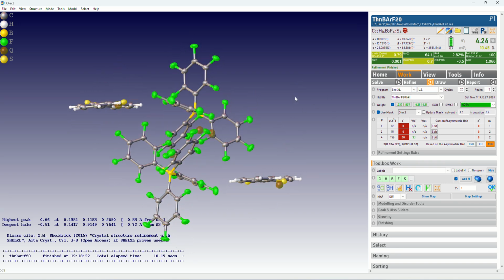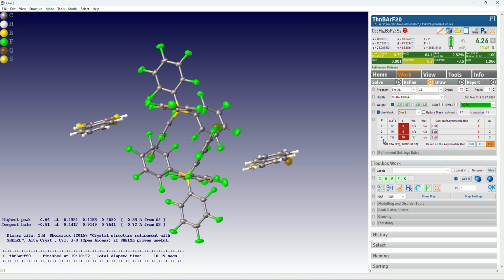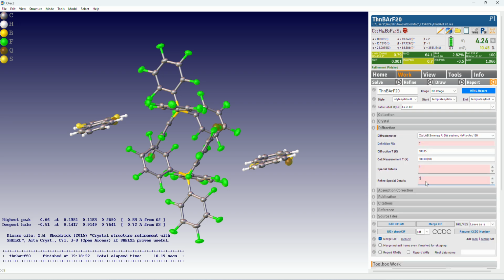Okay, so the last thing that's left is to describe in the CIF file that we used solvent masking. It is by default put in the CIF file by BYPASS, by OLEX, but I think it's always a good idea to also go to report. You can go to diffraction, and either in special details or refine special details, you can write something like, I don't know, solvent masking was necessary because of a large amount of diffuse electron density corresponding to disordered solvent that couldn't be modeled. The solvent masking procedure indicated voids with a number of 50 electrons, which is close to the value of 49 expected for toluene, or the other way around, sorry. Yeah, so that's basically it.